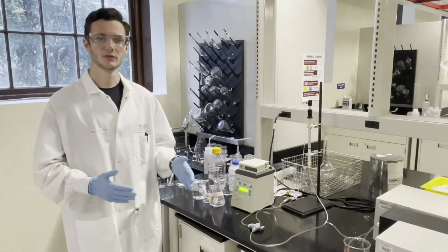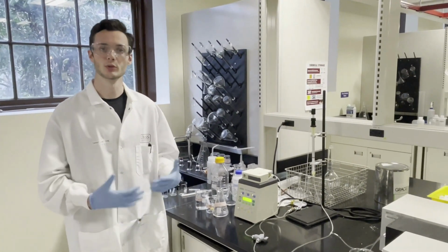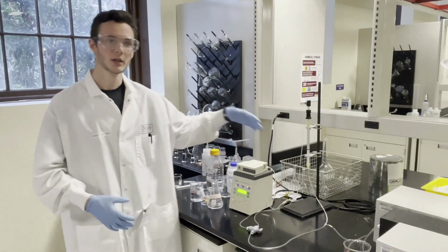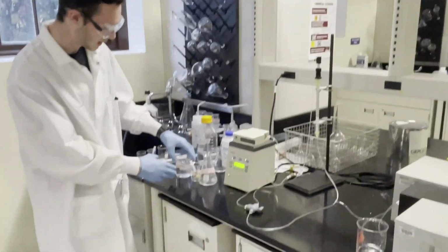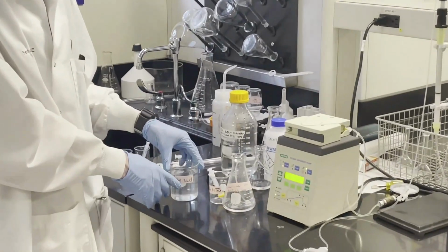And so now that we've successfully gotten all of our positively charged protein out, it's time to elute our negatively charged protein that's weakly bonded to the resin in the column. To do that, we're going to use what's called an elution buffer. In our case, we're using a NaCl and water solution, so a salt water solution with a concentration of 1 molarity.